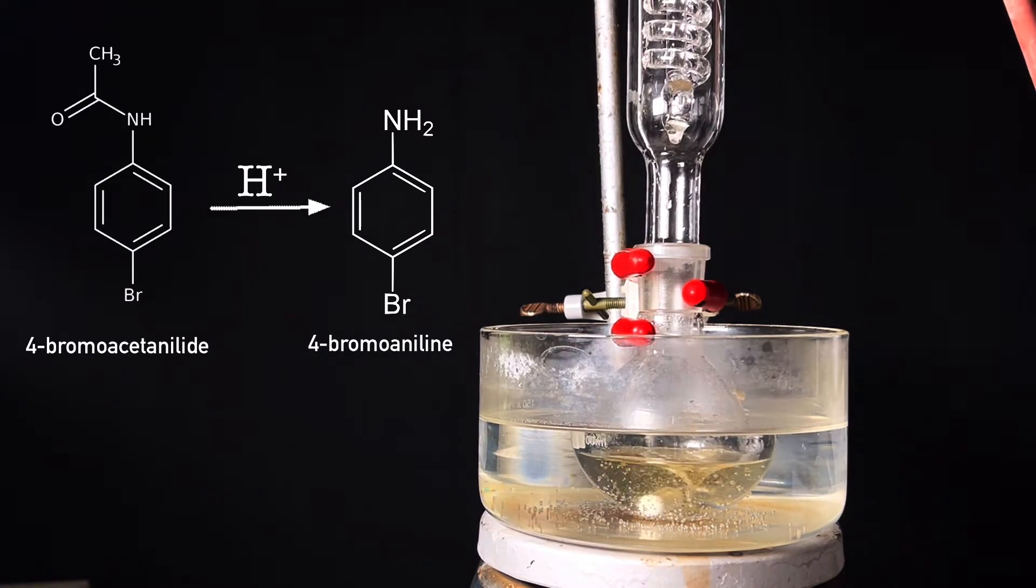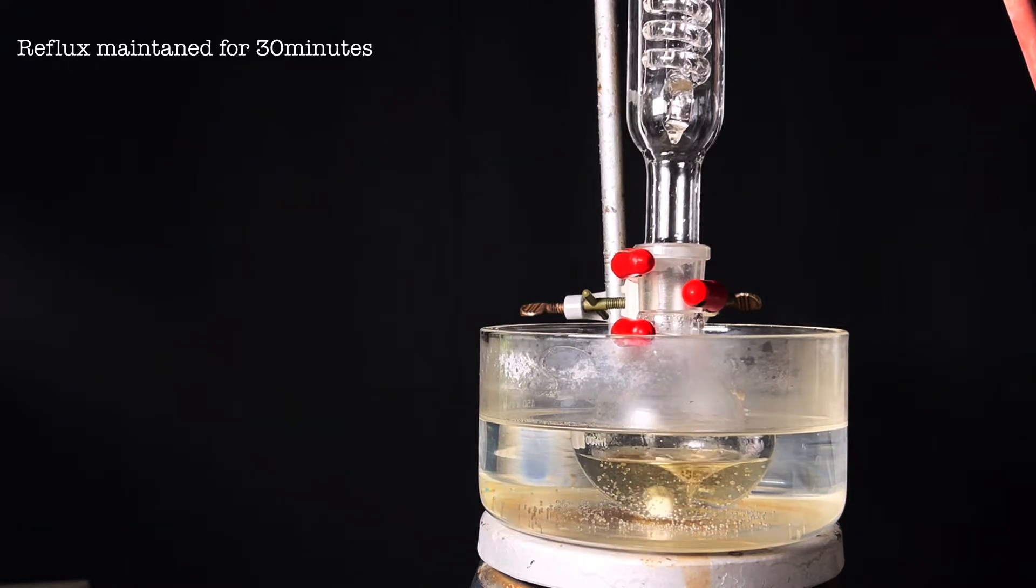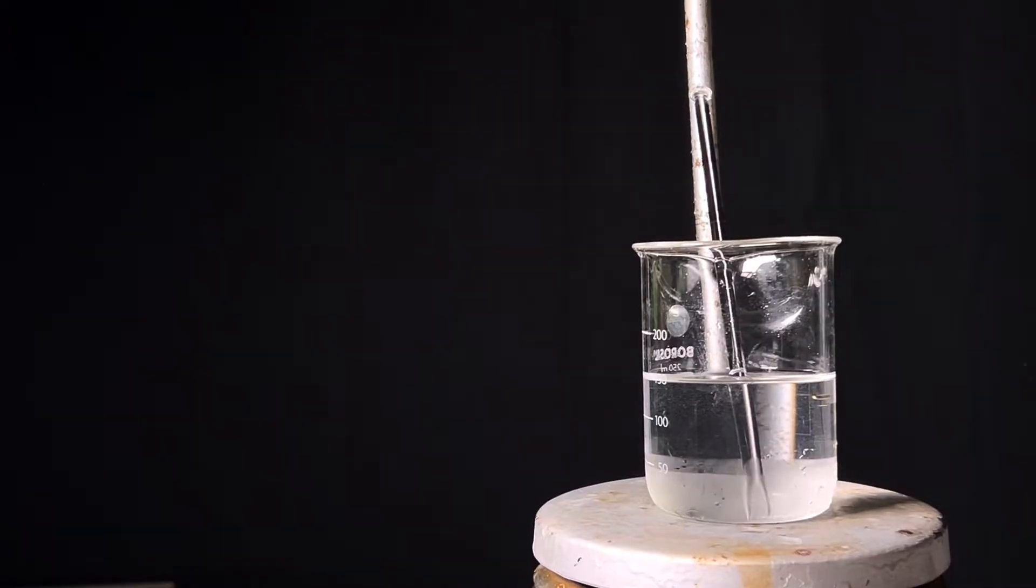Reflux was maintained for 30 minutes, after which the flask was allowed to cool down to room temperature.